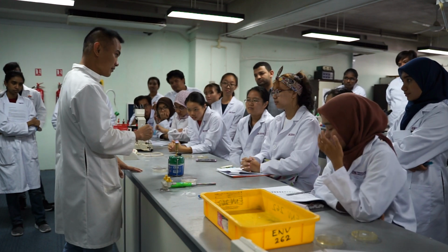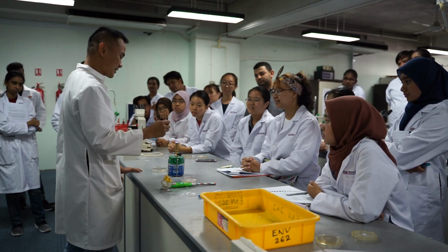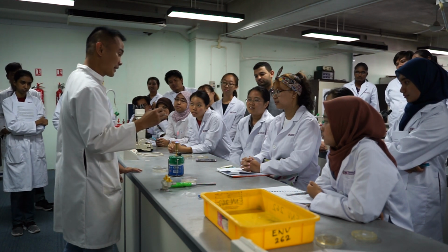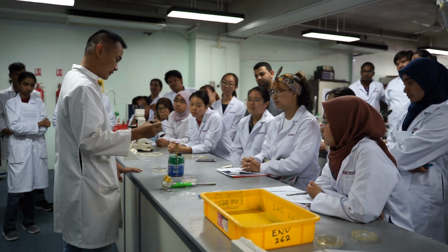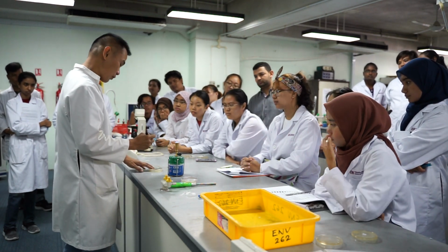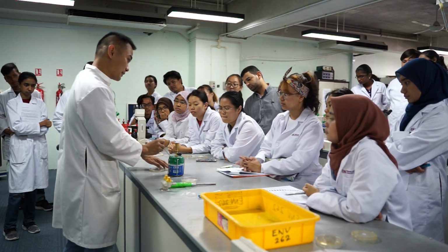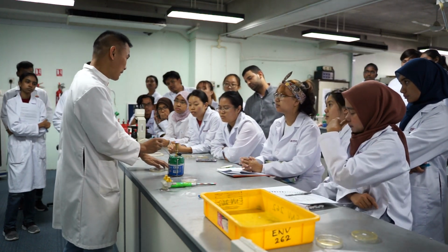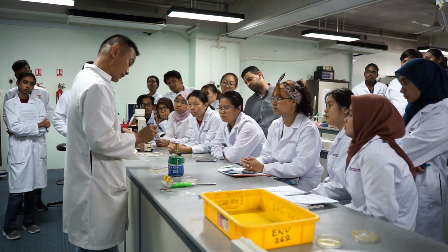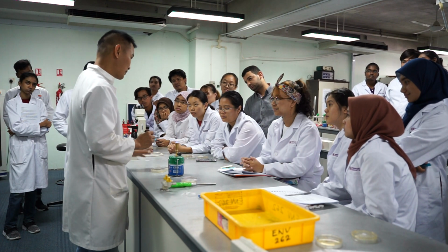But this week, streaking. So I already burnt this. Can I do it now? Cannot. I already left it for a long time over there. So I need to burn it again until it's red. That's fine. Leave it until it's cold a bit. But it's gonna be warm, hot. But you're streaking now. Normally, you can also touch it first into the agar plate to cool it down. But because now we are isolating, we don't care because there will be a lot of bacteria. So I'm gonna stop talking here.